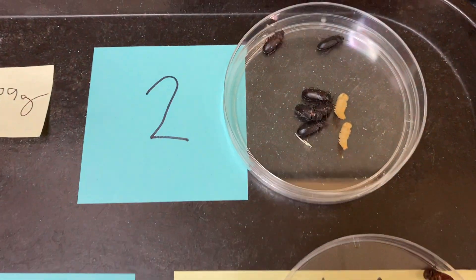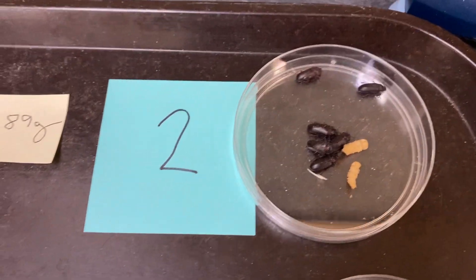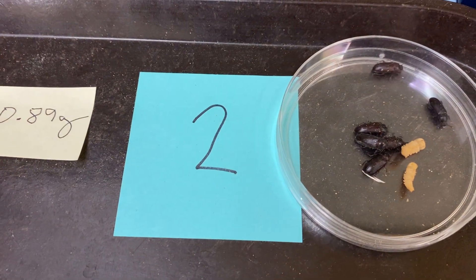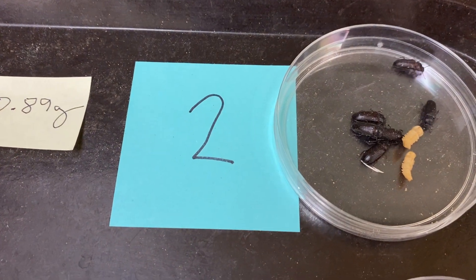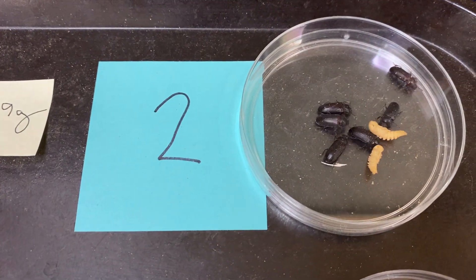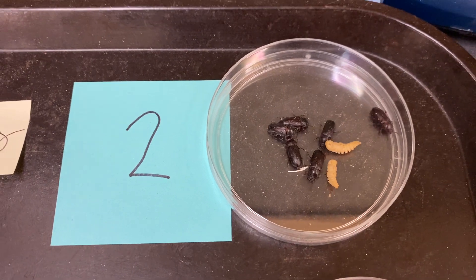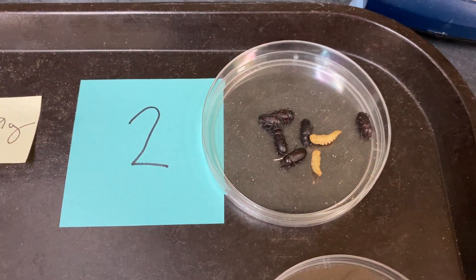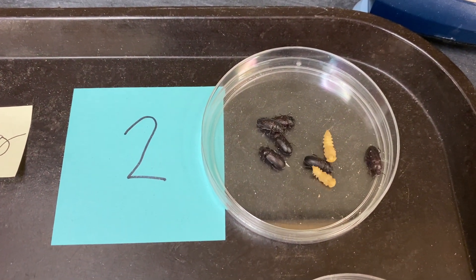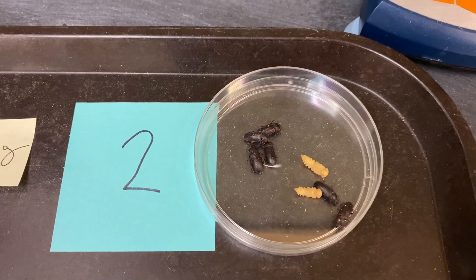For control colony number two, you can see we have one, two, three, four, five, six, seven, eight. The lighter-colored pupae — still count those as one organism each. So we have a total of eight for control colony number two.